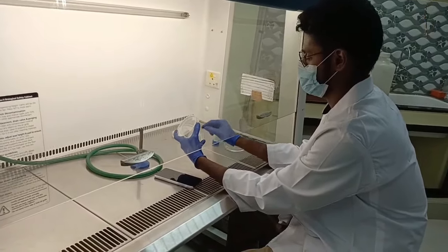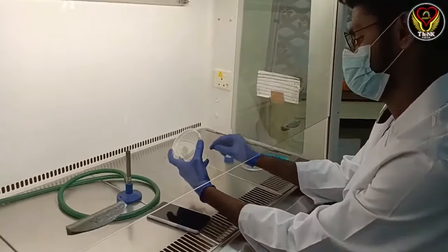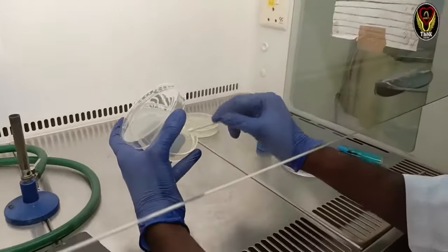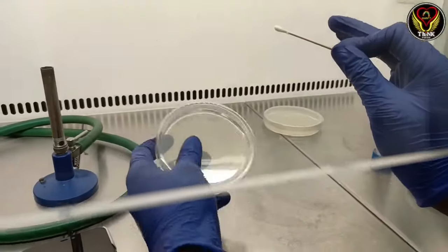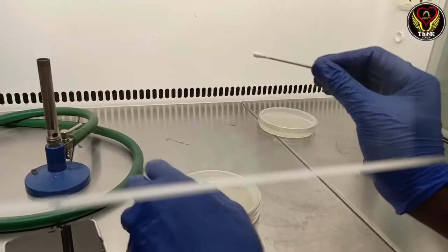We will swab every corner of the plate. We will complete the swabbing and inoculation procedure.